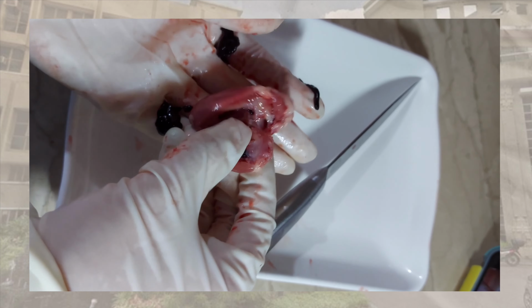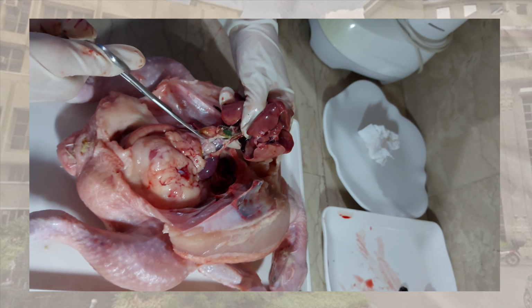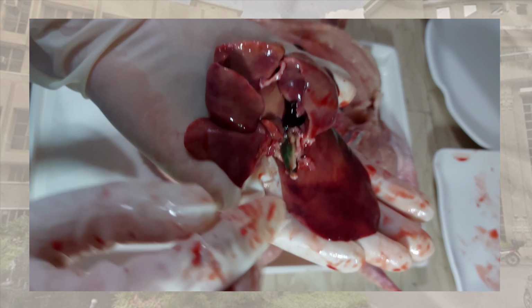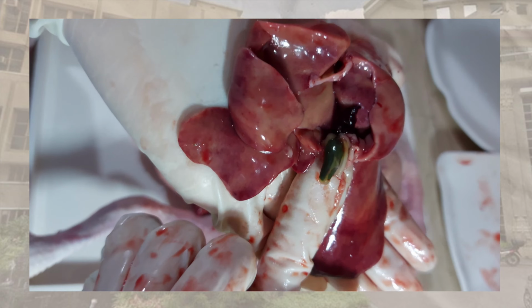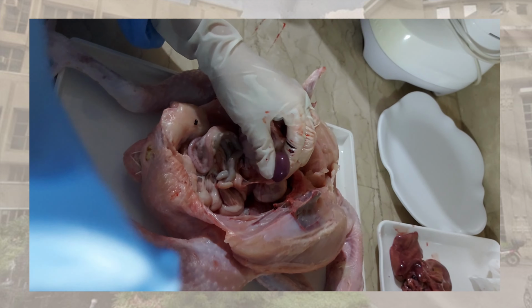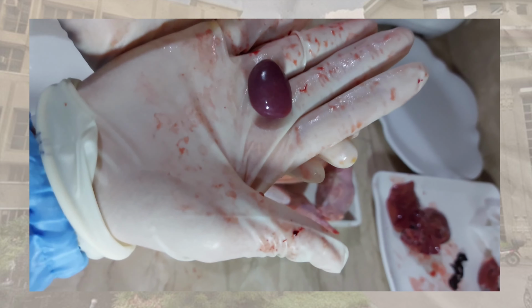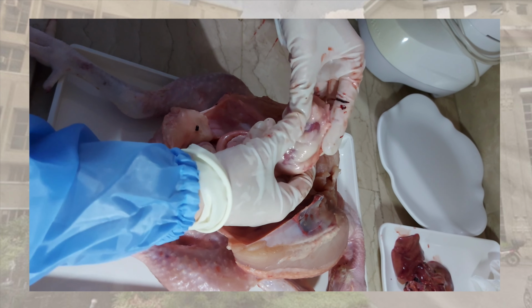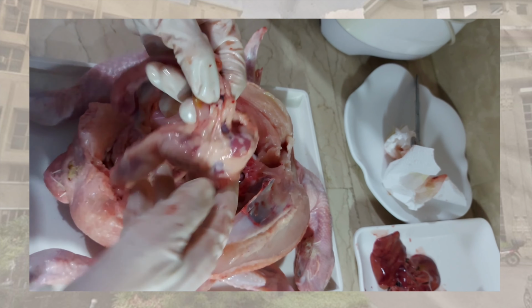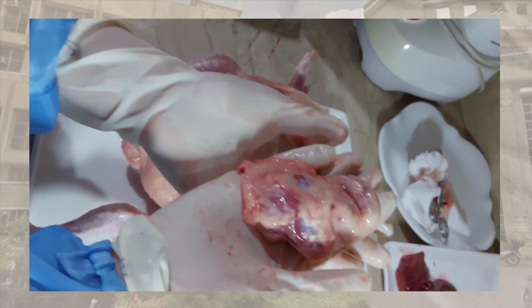To clearly see the other organs, especially in the digestive system of the patient, and to properly execute the autopsy, she removed the other organs of the patient. She first removed the liver, and attached to it is this green jelly-like organ, which is the gallbladder. Afterwards, she examined the spleen, which is a lymphoid organ close to the stomach of the patient. Meanwhile, slightly inferior to the spleen is the stomach, which was also removed because it blocks the intestines. As you can see, the stomach is mostly made up of muscular walls for contraction and digestion.